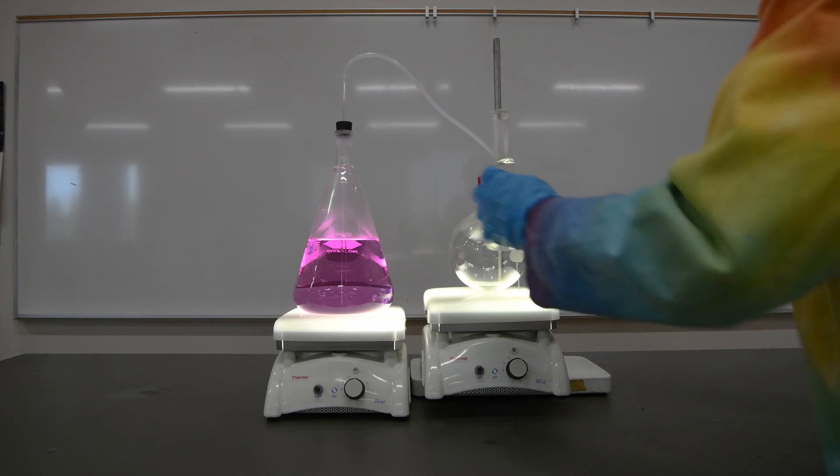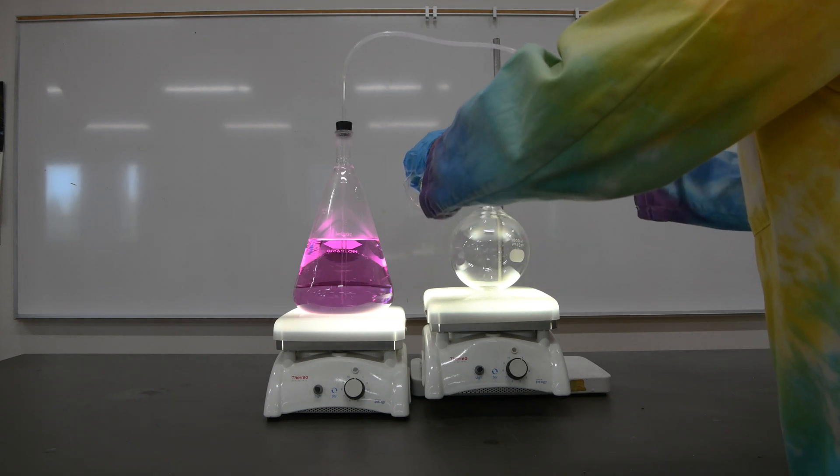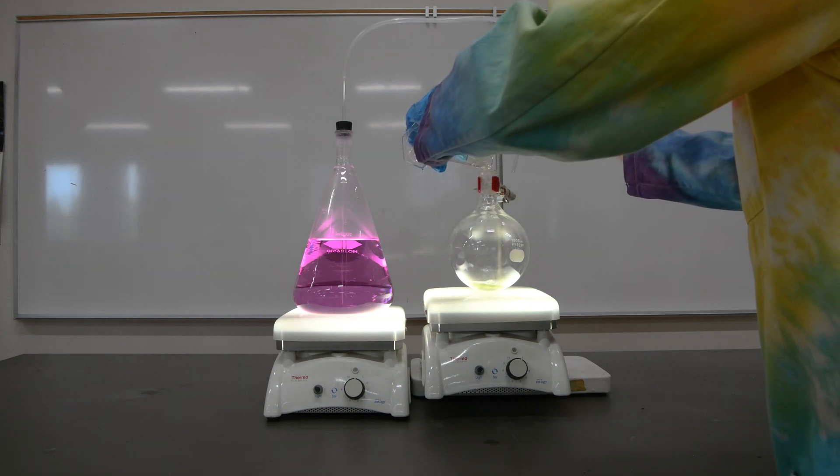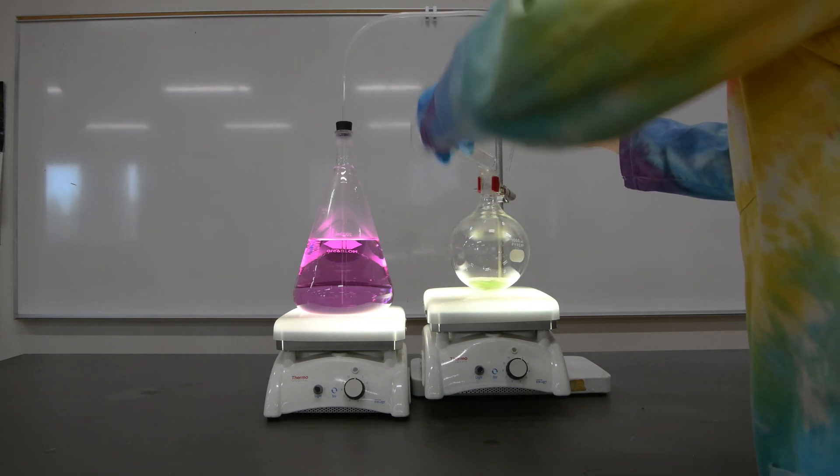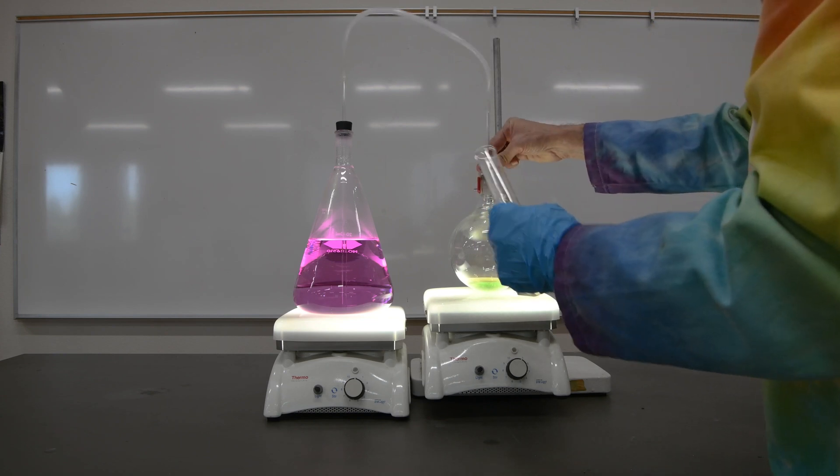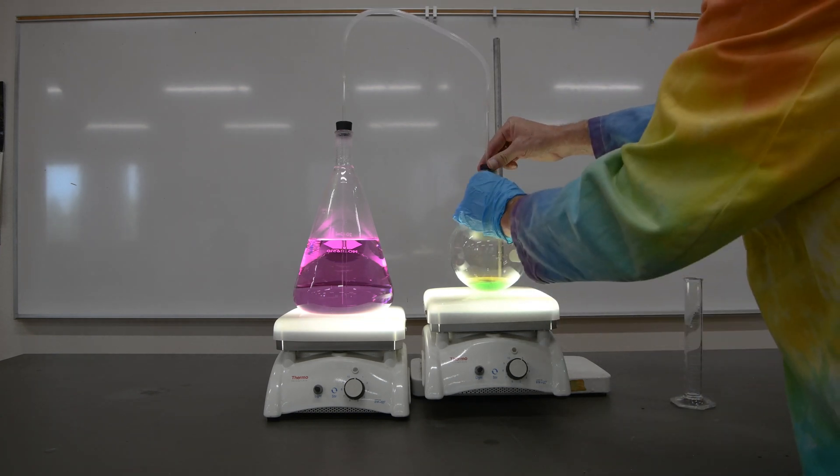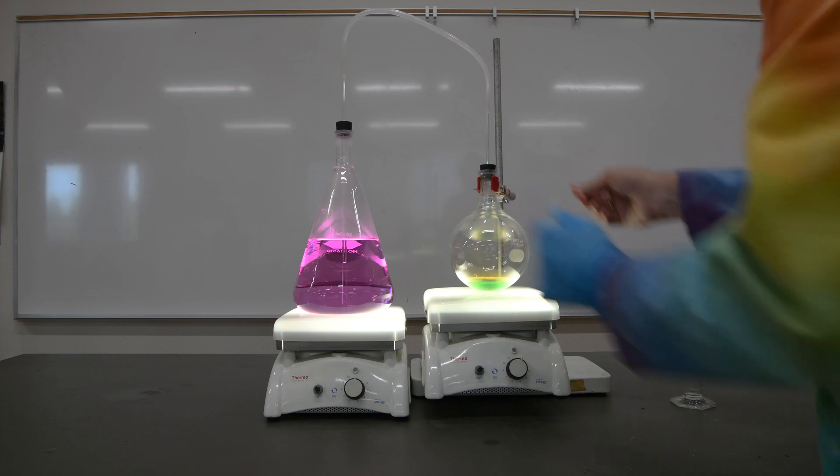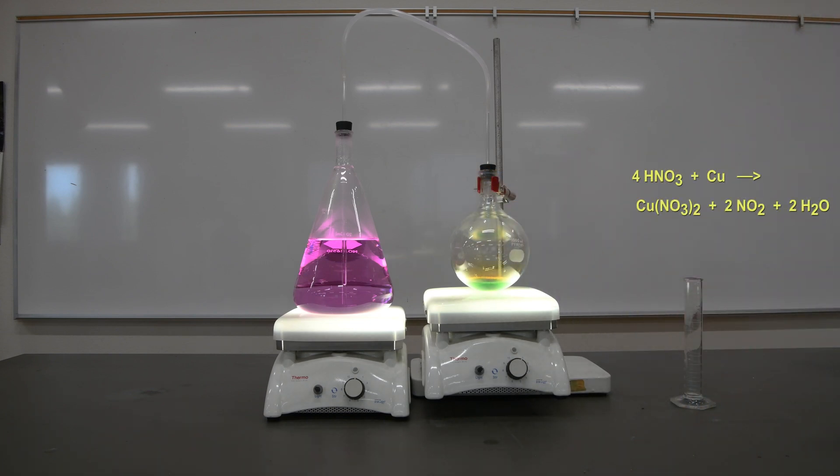Let's go ahead and add our nitric acid, and then we're going to very quickly seal up this flask, because it's going to start producing a rather noxious gas, nitrogen dioxide. So let's observe what happens.